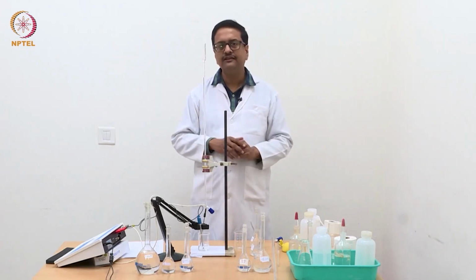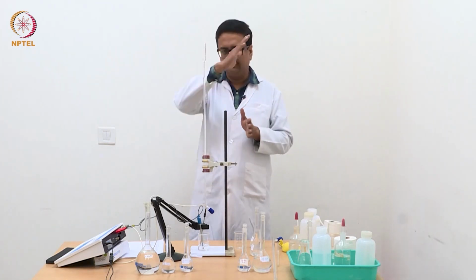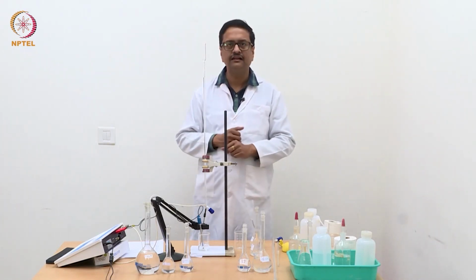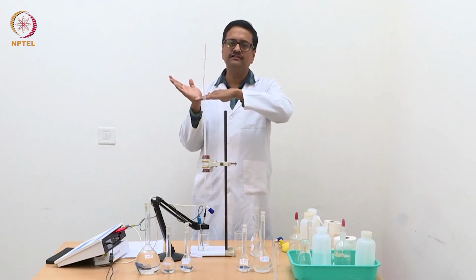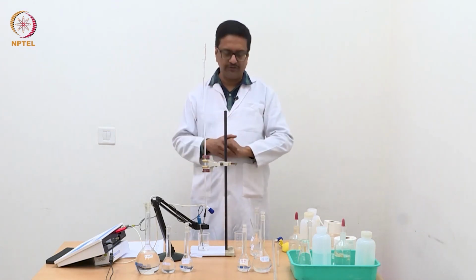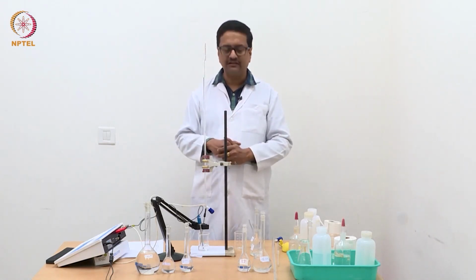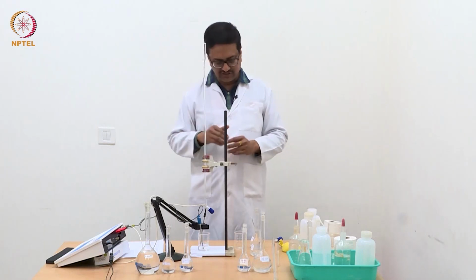So this will give us the estimation of the concentration of HCl, so that you have one line and the second line, and the meeting point will give you the concentration of HCl. And then the second line, when it ends, there will be an increase in conductance, and from there you will get the end point for ammonium chloride. So this one experiment with NaOH in the burette will give you estimation of HCl and ammonium chloride.